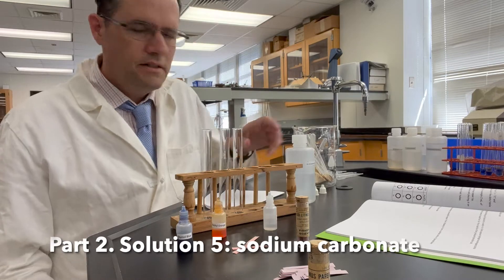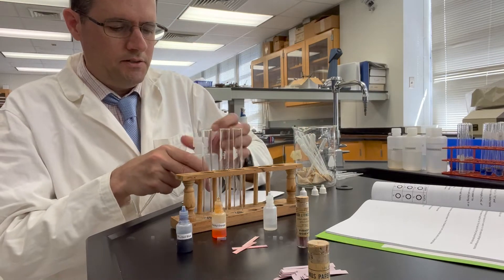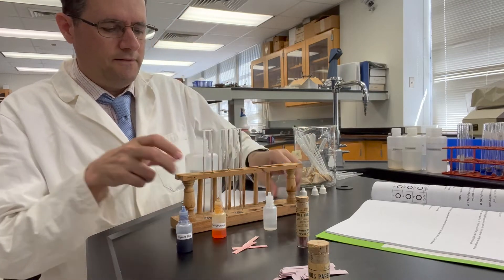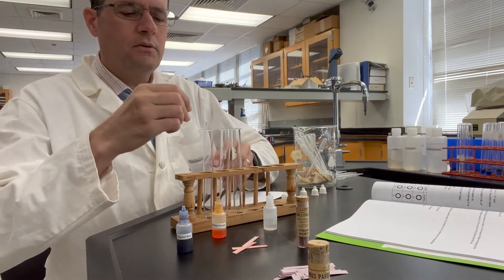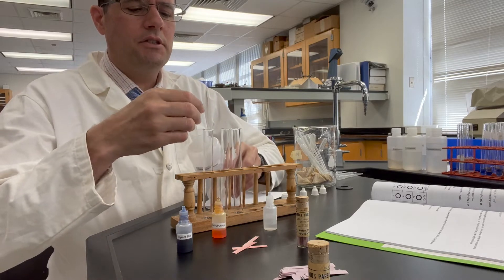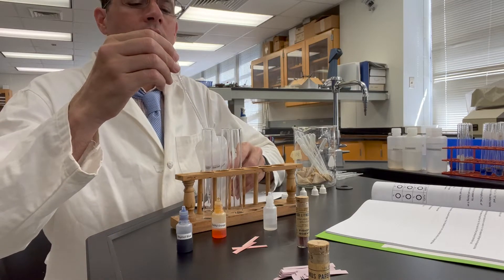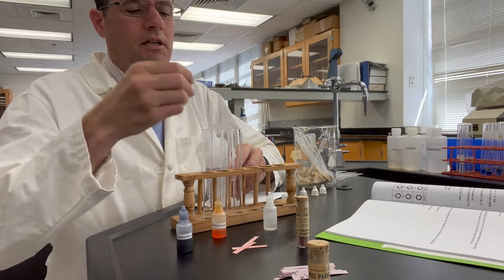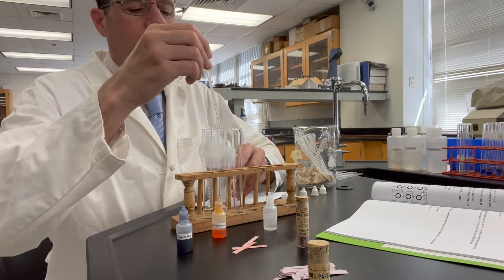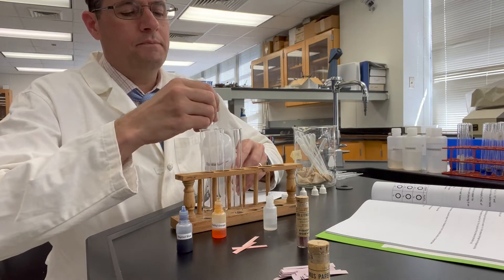Let's go ahead and test solution 5. I've got test tubes 5a, 5b, and 5c set up here. We're adding 2 milliliters of 0.1 molar sodium carbonate.